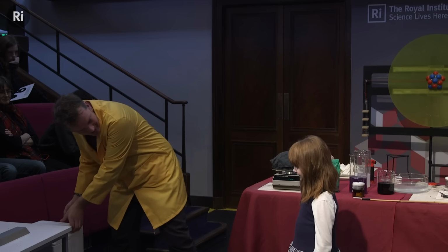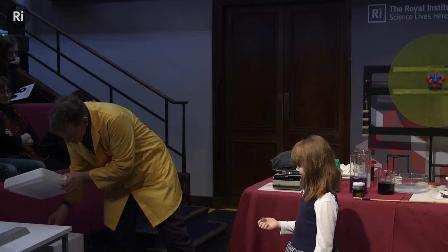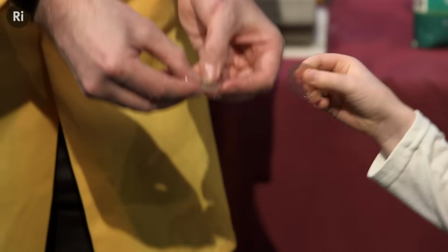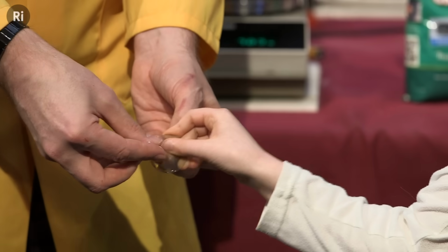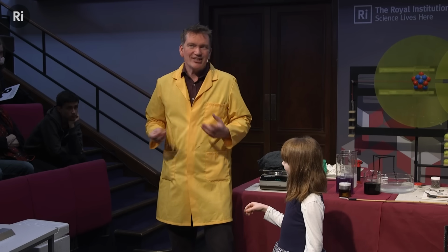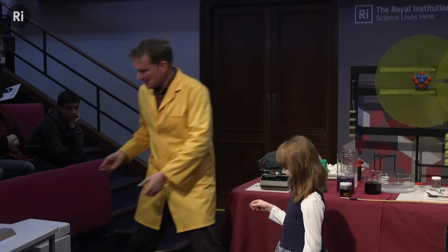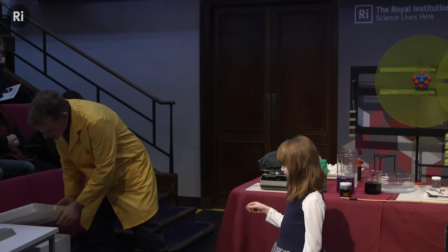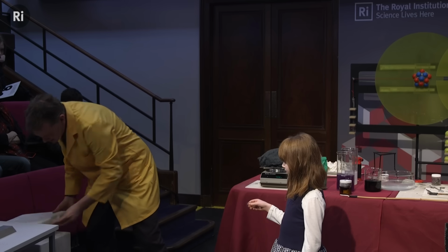Did you notice anything? It went cold. It went instantly cold. And we'll just try this again. Just try pushing down. So instantly it goes cold, and you cut through. You're cutting through not because it is hard, which it is, okay, but you're cutting through because it's using your body heat.